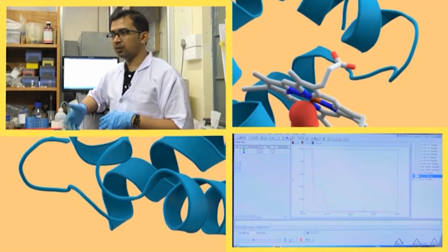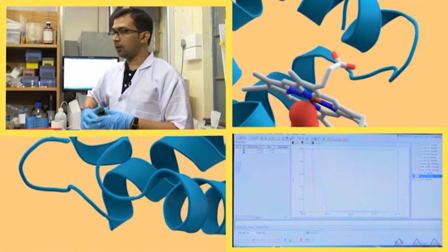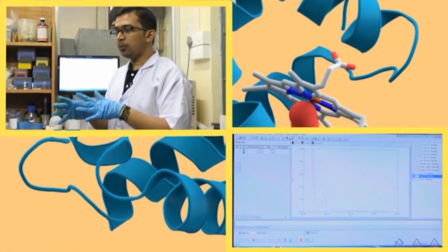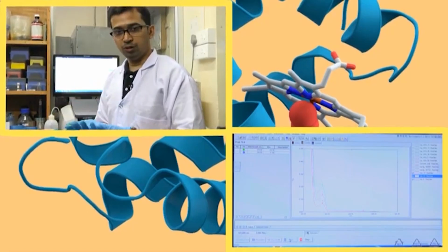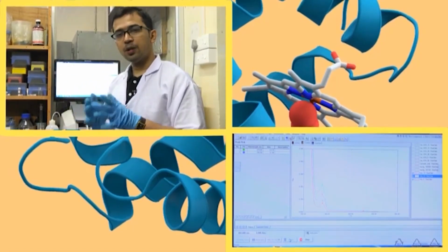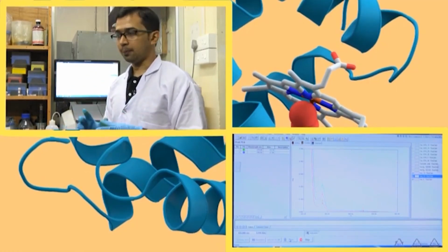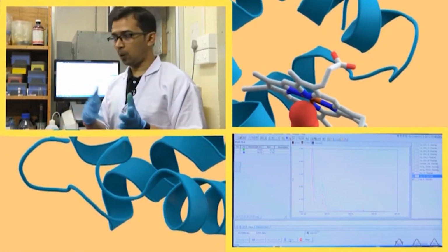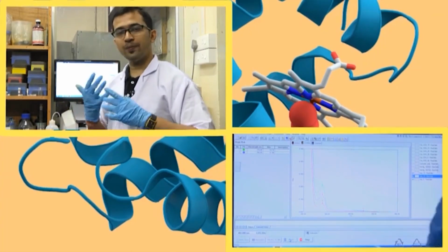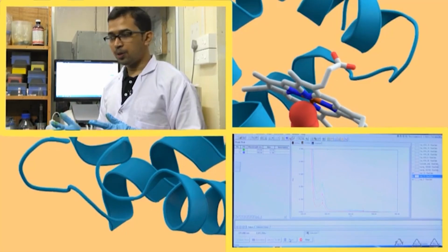There are various other methods which you have also seen, some in the theory classes. Okay. However, apart from this, one spectrophotometric method is also fluorescence. In case of fluorescence, we measure in just the opposite way. We take the protein. Just note it down, we are not doing it here. We take a protein solution and measure the fluorescence emission of the protein.